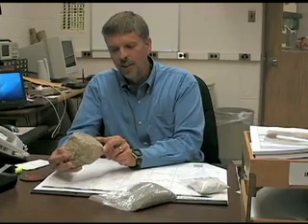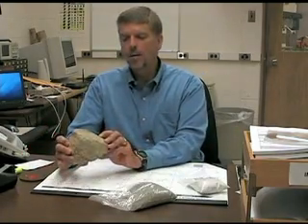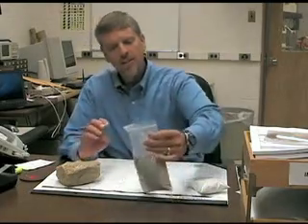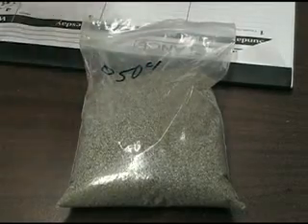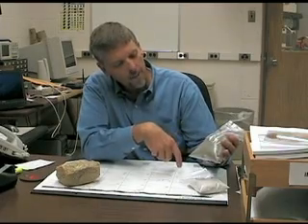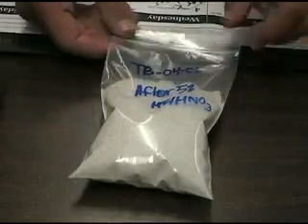The first step in the process is to crush this rock. This will be done in a rock mill, and once the rock mill is done with it, it will be in pieces less than the thickness of a dime. This is a crushed piece of granite, and you can see it has a lot of different kinds of individual minerals — some are very light colored, some are very dark colored. Where we want to be is right here: very light colored — this is pure quartz.